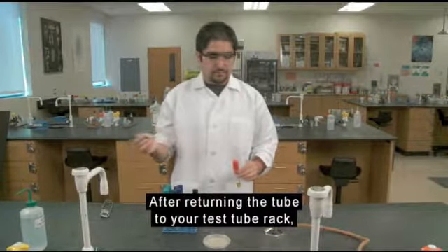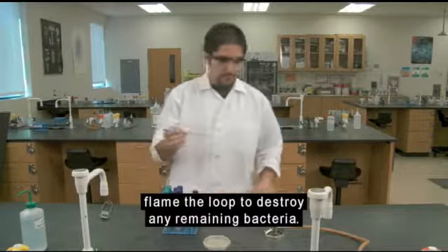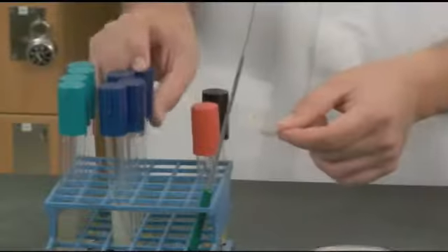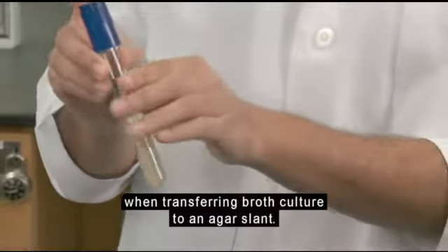After returning the tube to your test tube rack, flame the loop to destroy any remaining bacteria. Make sure the entire wire gets red hot, not just the tip. Now let's see how this procedure differs when transferring broth culture to an agar slant.